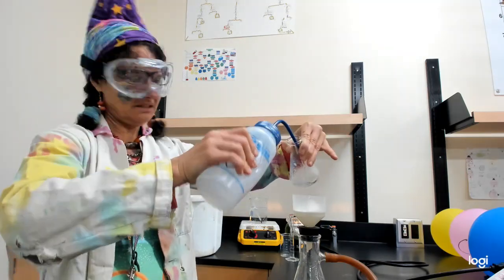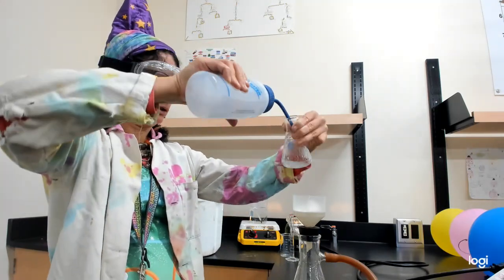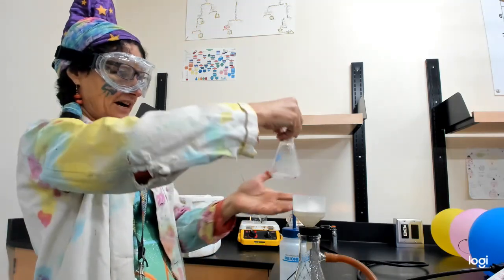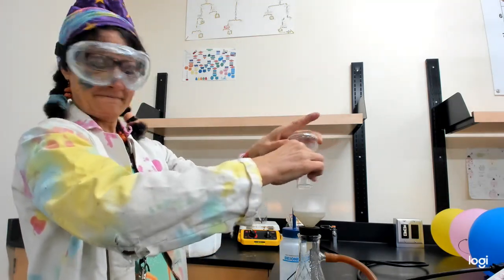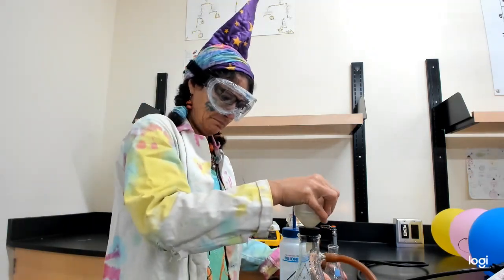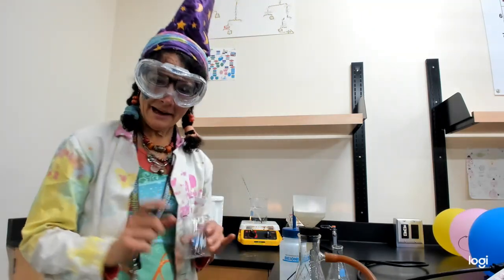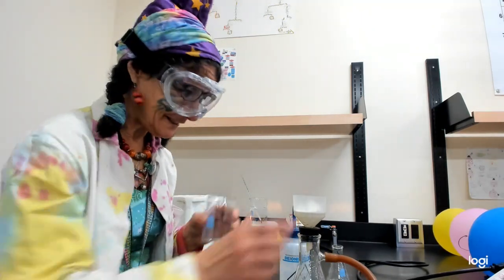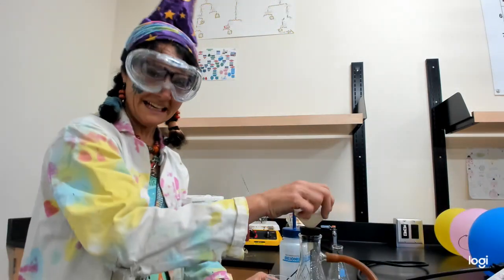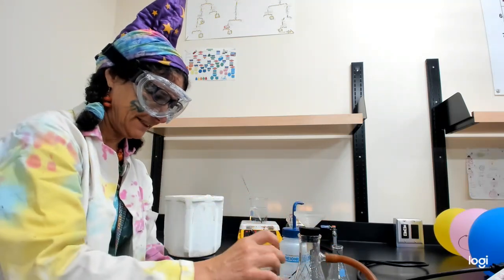All right, we do our best. Maybe we get all of it, maybe we don't. There's always room for losing some crystals. I'm good with that. So we'll let it suction, pull out some of the water, and then I'm going to transfer all my crystals so we can turn off our vacuum. We'll be back to the vacuum because we're going to recrystallize it. Let's make it even better than it was.